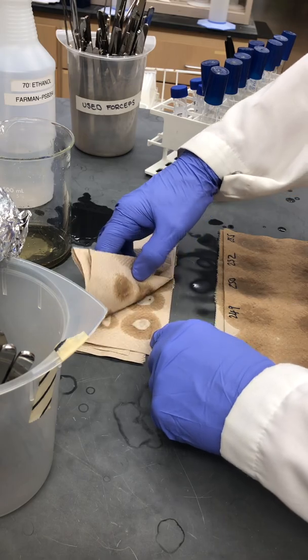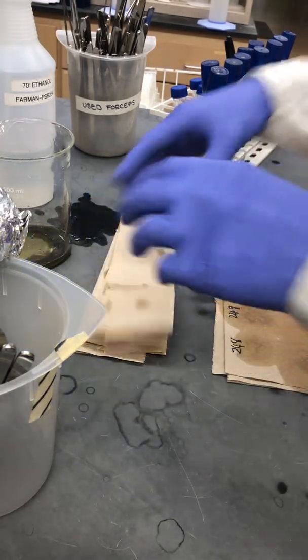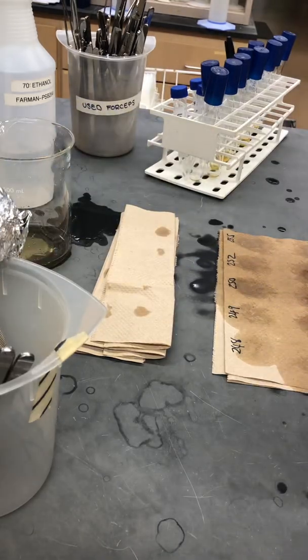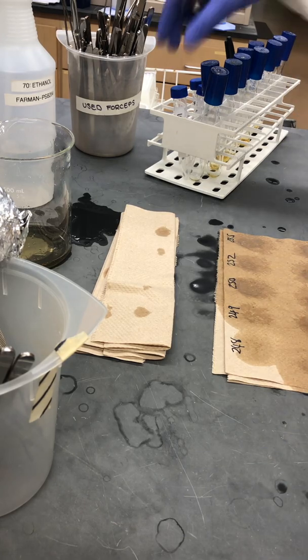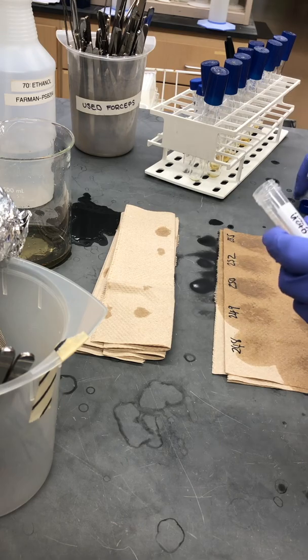If we wish to, we could store each pair of forceps in the rack so that we could go back to the same pair of forceps for the same culture. But I'm not worried about using up forceps here because we've got plenty on hand.